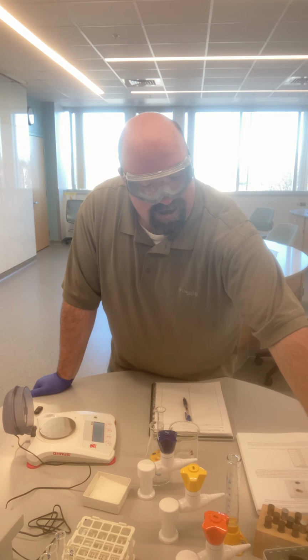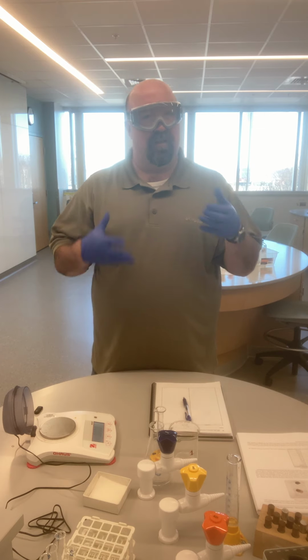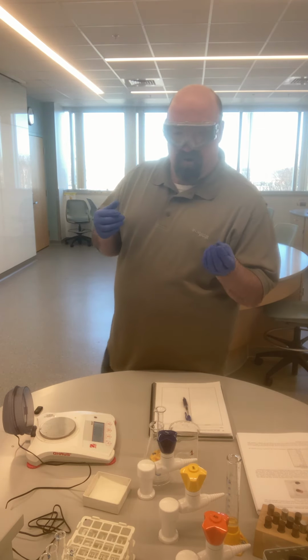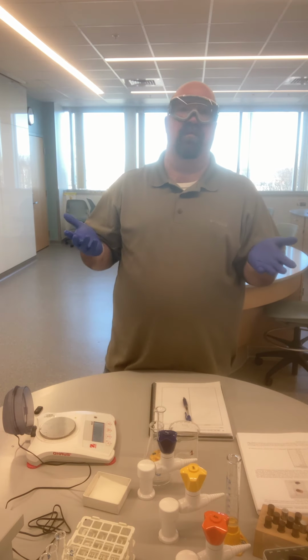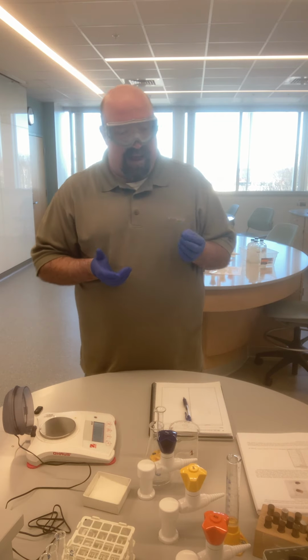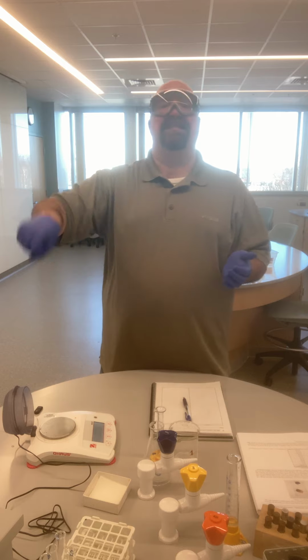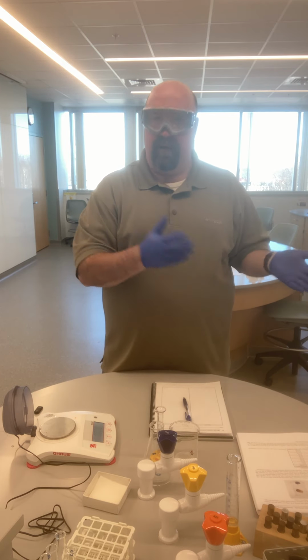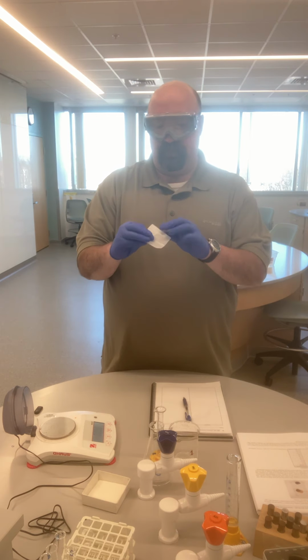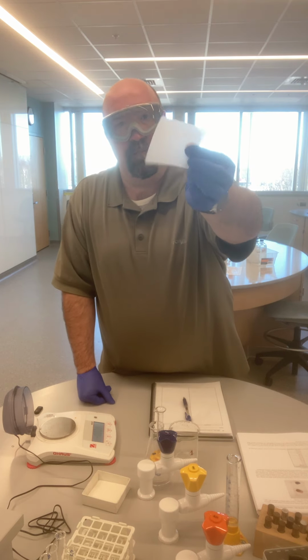Let's say that we're finding the mass of some sort of powder or crystalline solid. Picture table salt. A lot of chemicals that we have in a chem lab have the structure and the form of common table salt or sugar, something like that. If I'm trying to find the exact amount of some sort of chemical like that, I can't simply dump that onto the balance and then pick it back up again and use it. So for something like that, we use something called weigh paper. Weigh paper, like this, just sort of this waxy paper.